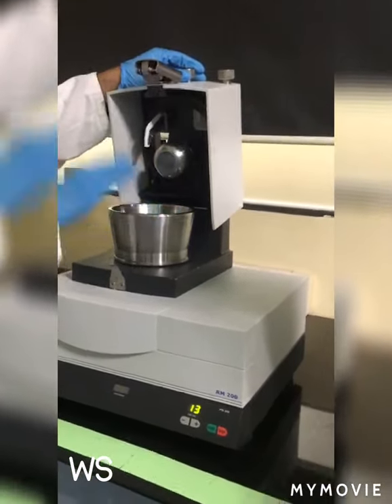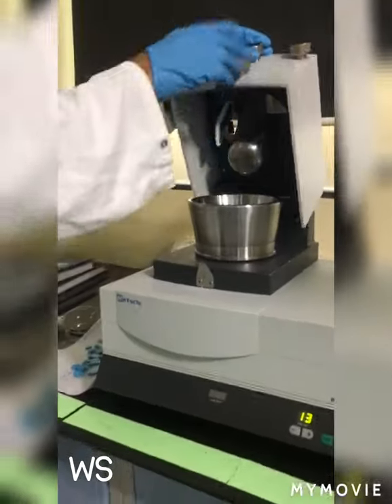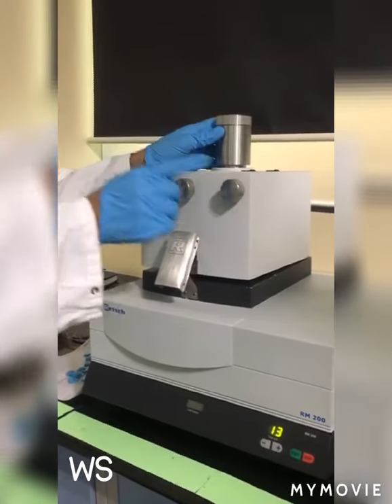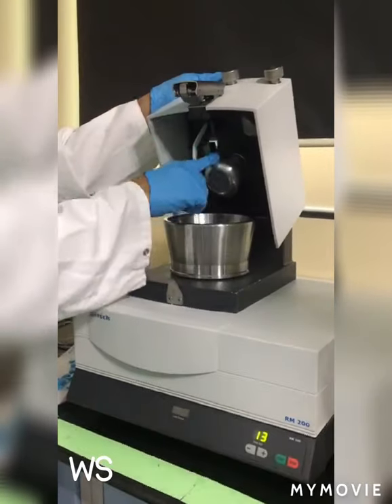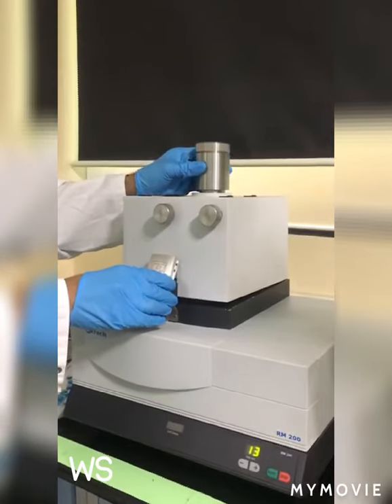It is 100 RPM — the motor which is actually moving — and this will be constant. We have two knobs: one is for the scrapper, and one knob is for the X and Y direction. The height is adjacent to the top one, like 8 mm.